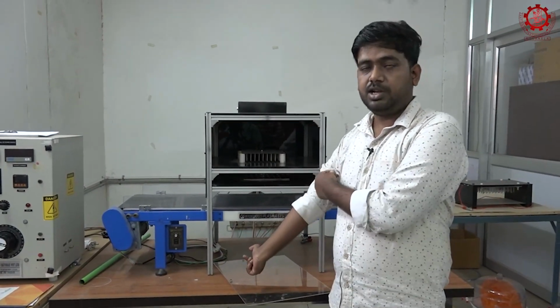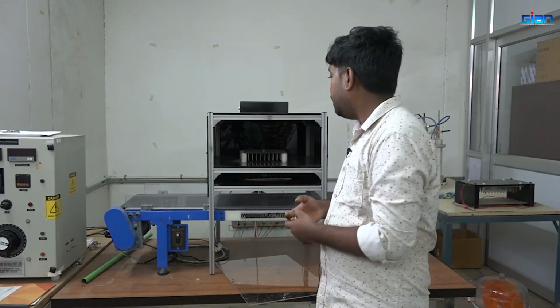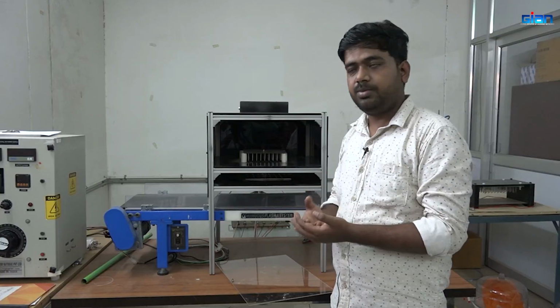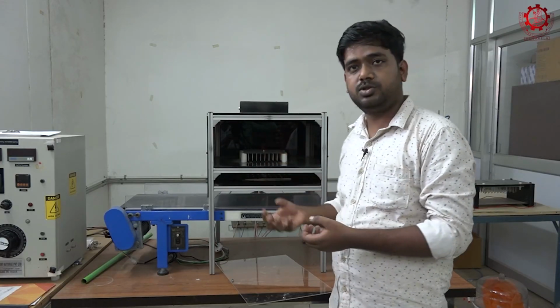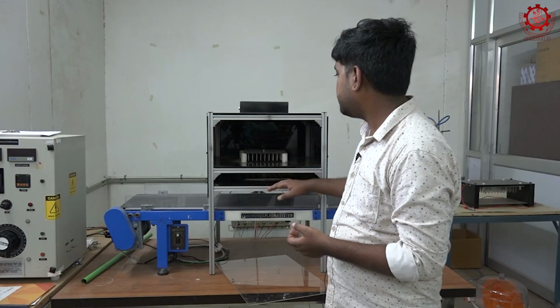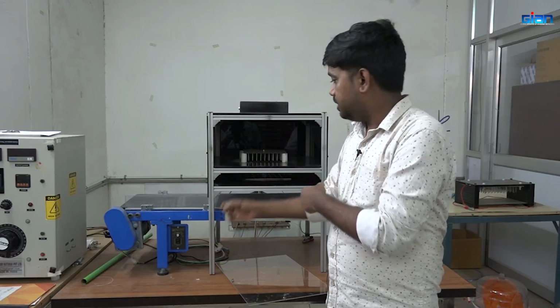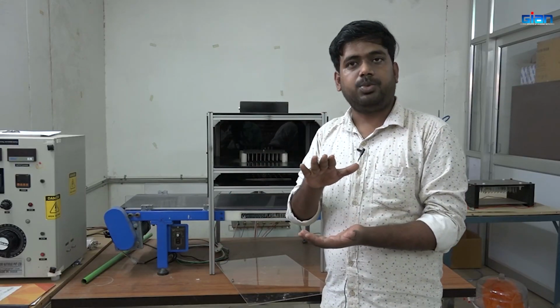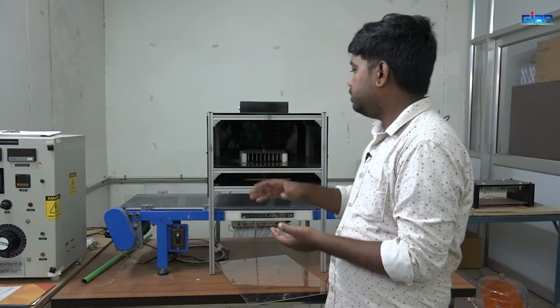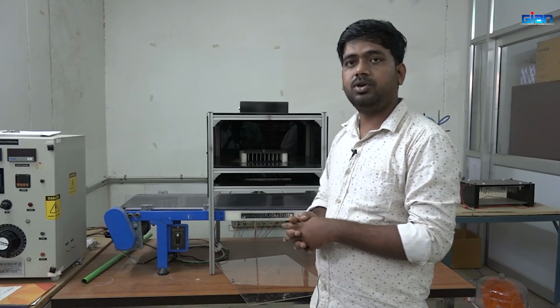So in this process there will be three phenomena happening. First, etching due to the reactive species, then bombardment due to the reactive species being generated, because when we apply a high electrical field, the electrons will be generated here and go down to the negative side, and then interact with the product surface. Also, the oxidation process will be going on.